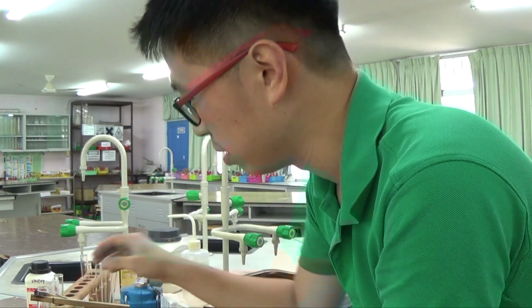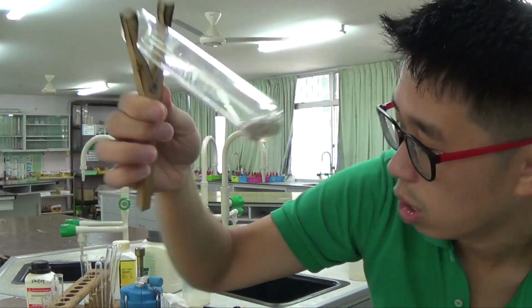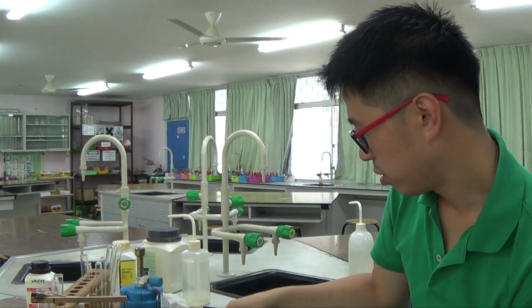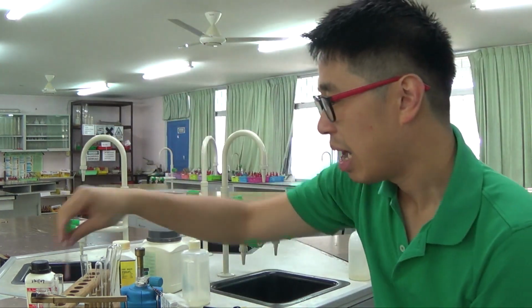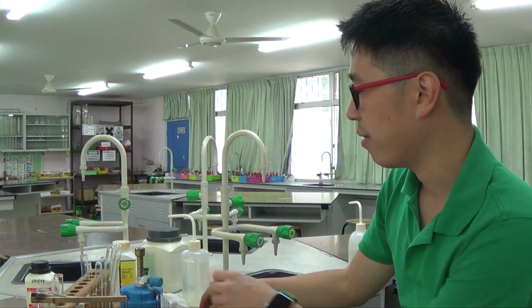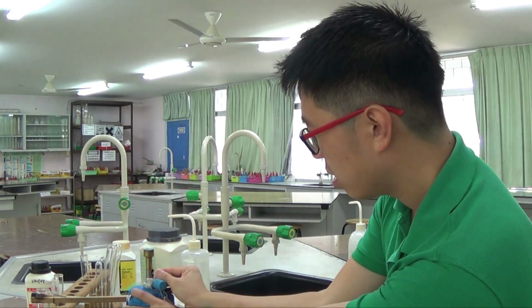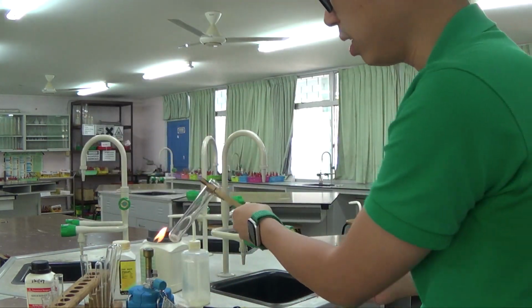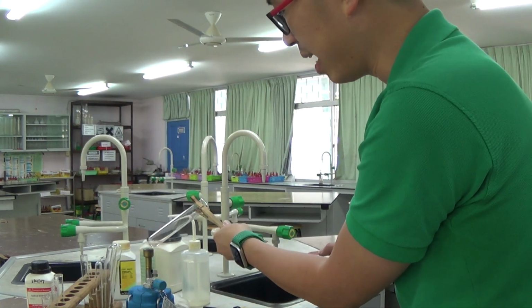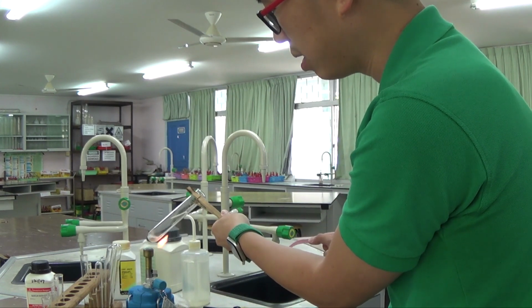Okay. So the aluminium foil on its own doesn't do anything. We can see the aluminium foil at the bottom, well, it is kind of floating on top of the solution. Remember my red litmus paper didn't turn blue just now because there was no more ammonia. I already have excess sodium hydroxide in there, so all I need to do is heat it. Using the blue flame, I will heat it with the aluminium foil inside, and any ammonia gas I get will be a result of the nitrate ion.